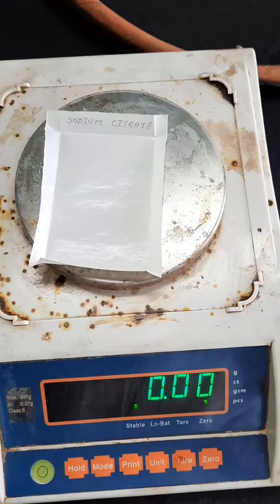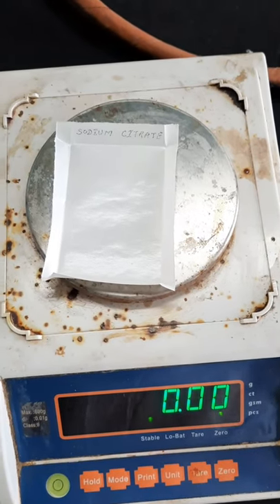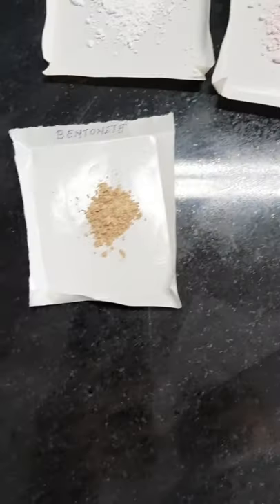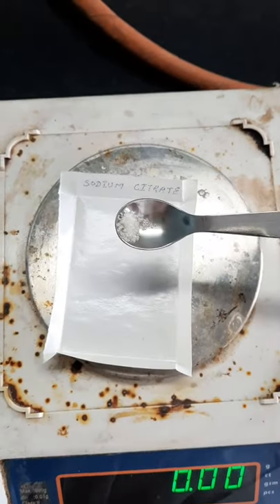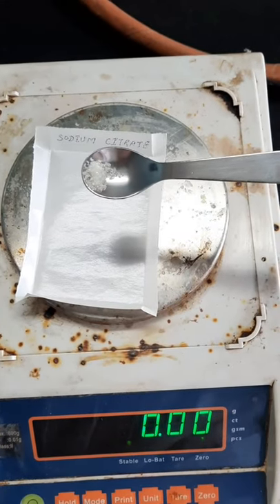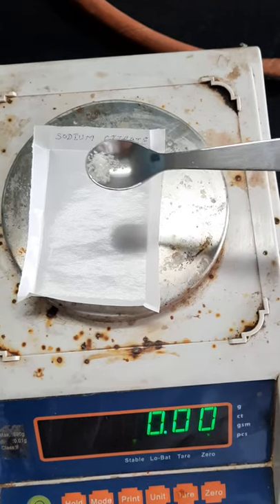The first step is to weigh each of these ingredients. I have already weighed zinc oxide, calamine, and bentonite. I will show you the weighing for sodium citrate — the required quantity is 0.1 grams.